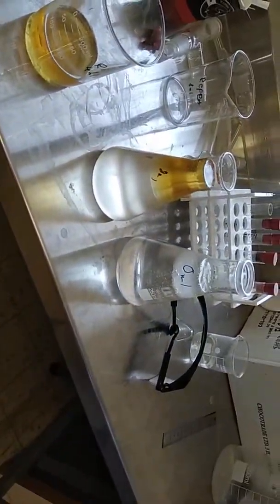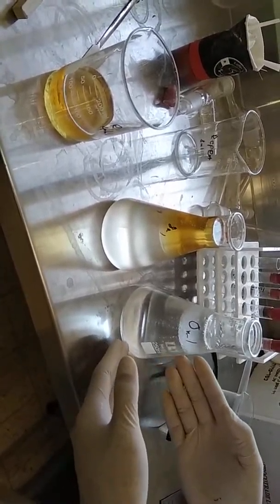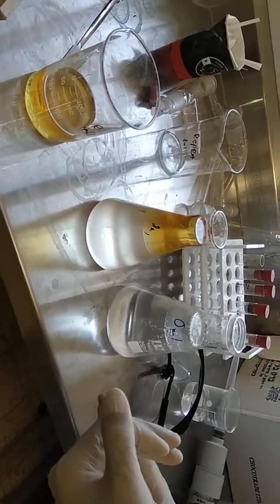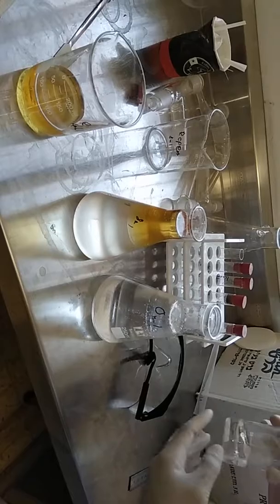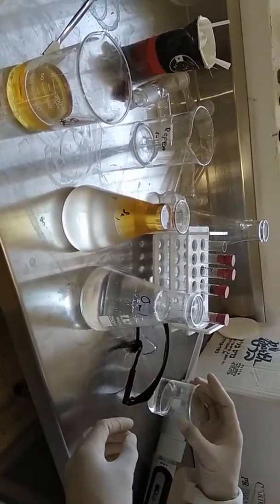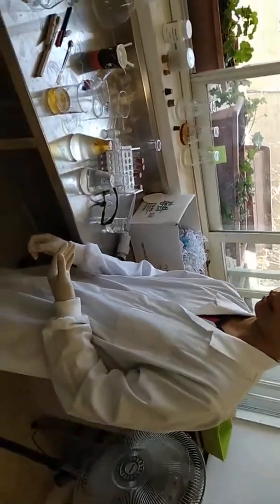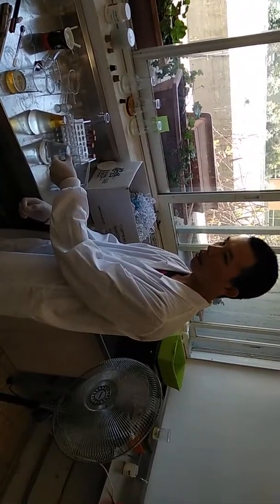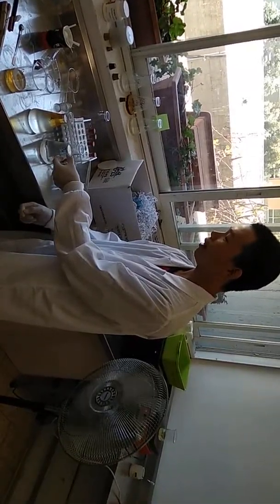And so the excess reactants of acid, alcohol, and catalyst can react with the sodium carbonate, so that I can neutralize this. And the one I get here is pure. It's not actually pure, but a purer ester.